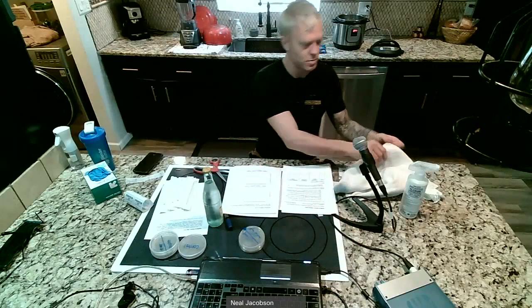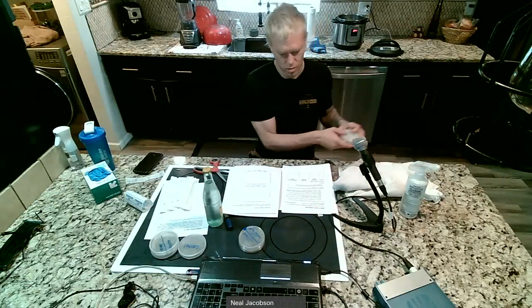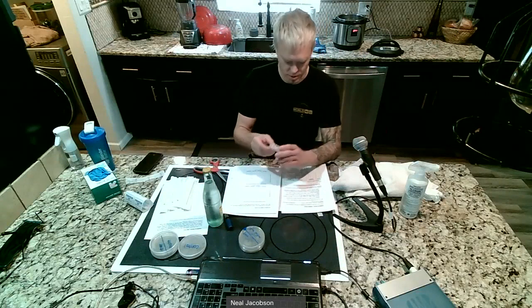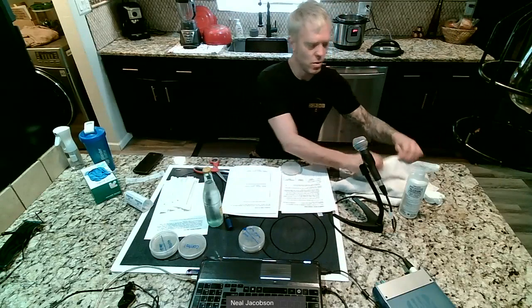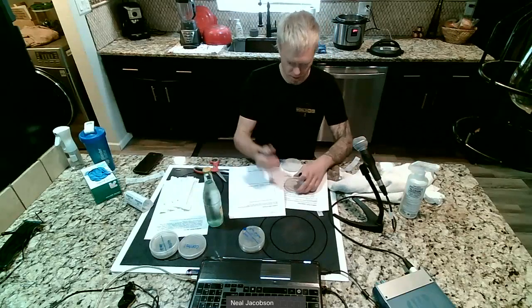Now, inanimate objects. So we'll take 2 more plates and we're going to divide them in half. And so these inanimate objects, that one looks like hell. These inanimate objects will be things like your TV remote, your cell phone, stuff like that.